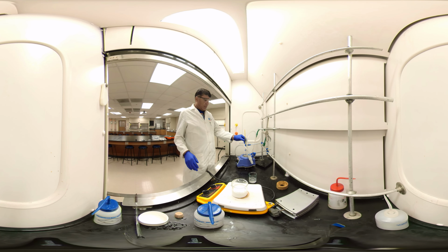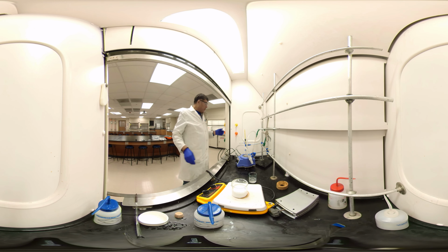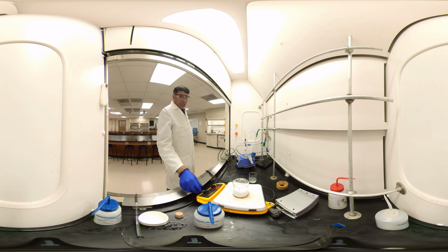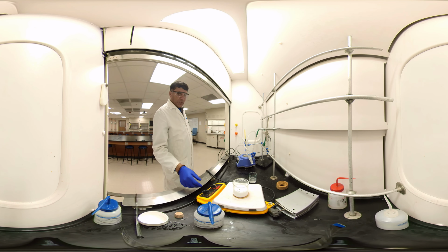So this one, the distilling of the dichloromethane is almost done, and there is only a little bit, 4 or 5 milliliters, left. It's coming slowly, so I'm going to turn this one off and let the heating mantle cool down. Only the remaining dichloromethane will come out, and whatever remains there should be mostly benzyl alcohol with some solvent left. Right, this one is still not dissolved completely. We have to wait or keep heating until everything dissolves. Then we'll cool down and have the nice crystals reappear. Let's see how it looks.